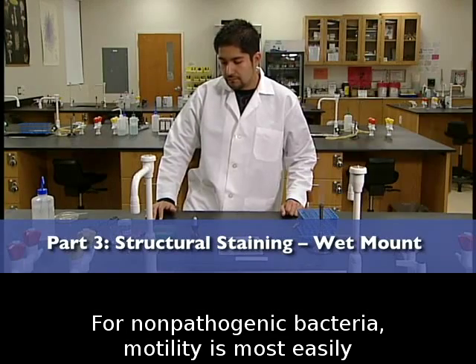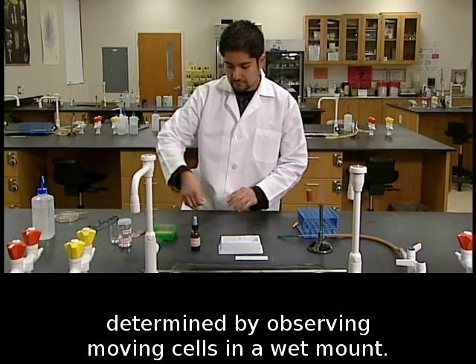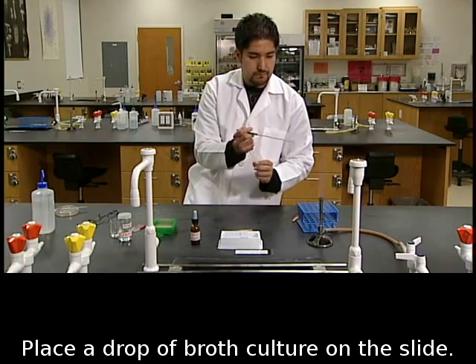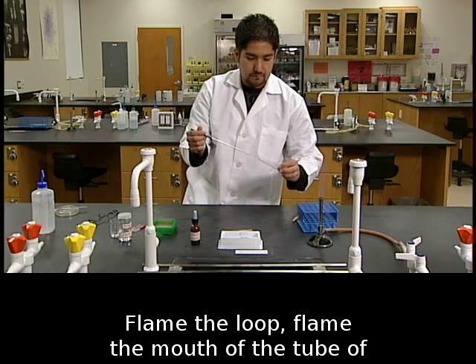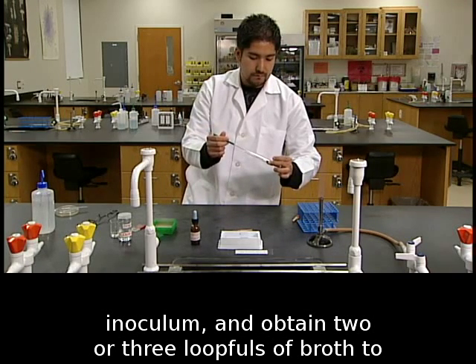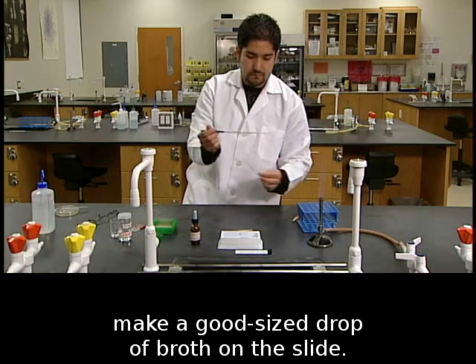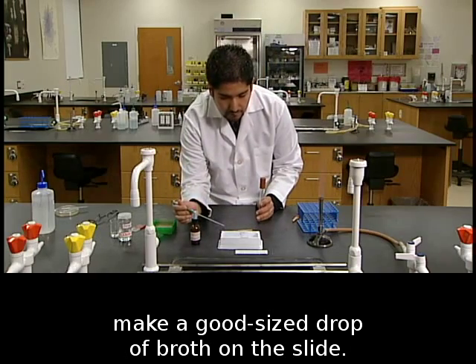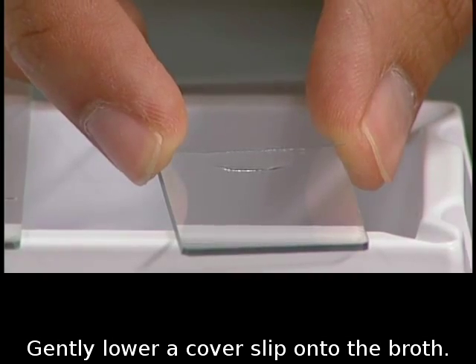For non-pathogenic bacteria, motility is most easily determined by observing moving cells in a wet mount. Place a drop of broth culture on the slide. Flame the loop, flame the mouth of the tube of inoculum, and obtain two or three loopfuls of broth to make a good-sized drop of broth on the slide. Gently lower a cover slip onto the broth.